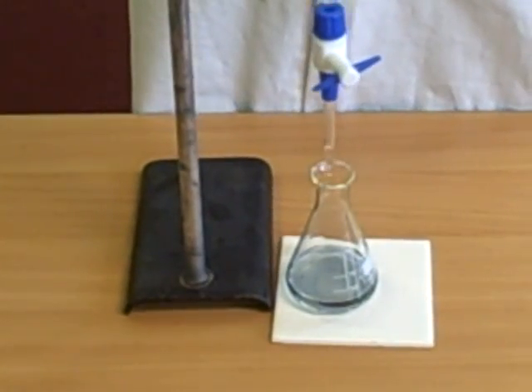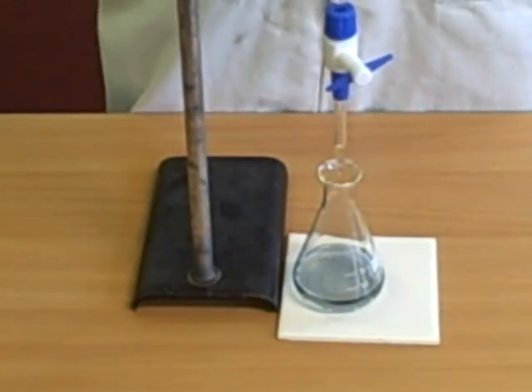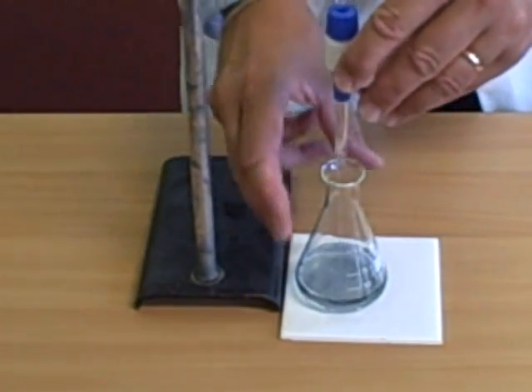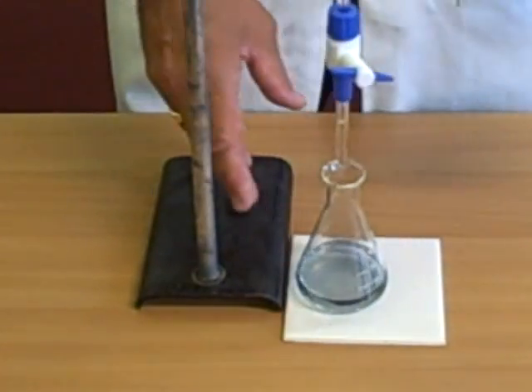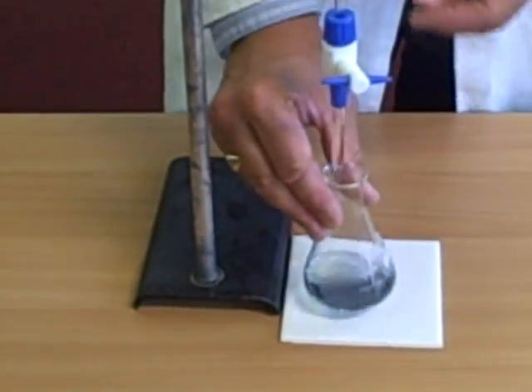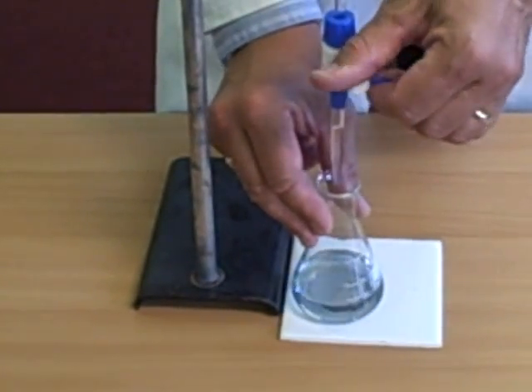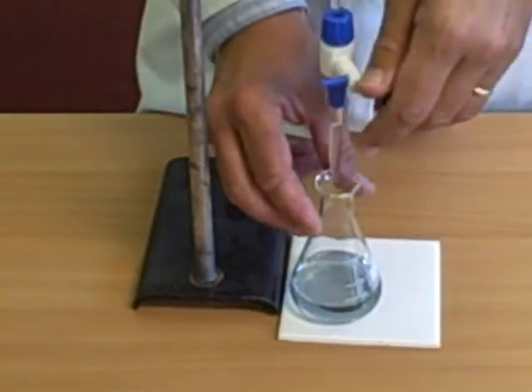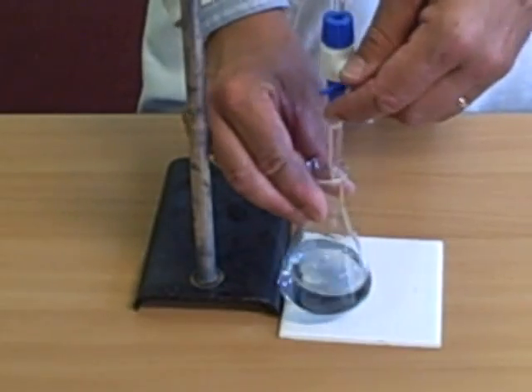Be careful of knocking this glass against here. Again, this is fragile. What you do now is, the first experiment that you do, the first set of measurements that you do, is the rough measurements. So you gently turn this, and what I do, say, count to three, four or five, stop, and swirl. One, two, three, swirl. One, two, three, swirl. Now, notice I'm not paying any attention to how much acid I've used. None at all. All I'm doing is, I'm looking at what is happening in my reaction vessel.